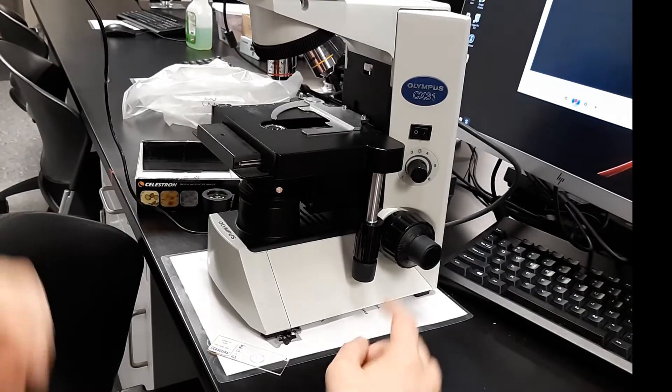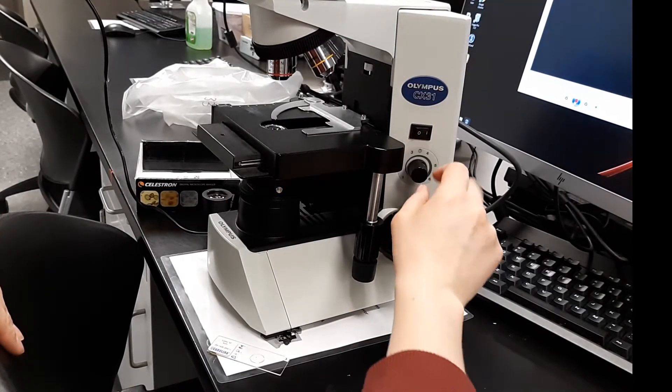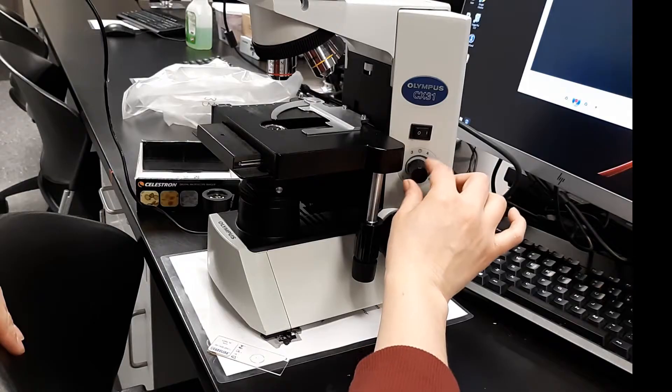We're going to make sure you turn it on, so zero is stop, one is go. We're going to turn this between three and four, this light knob.